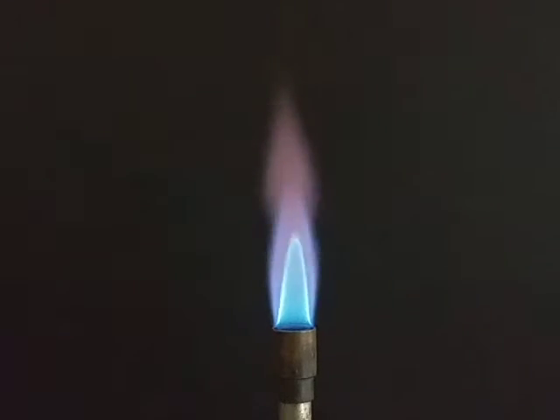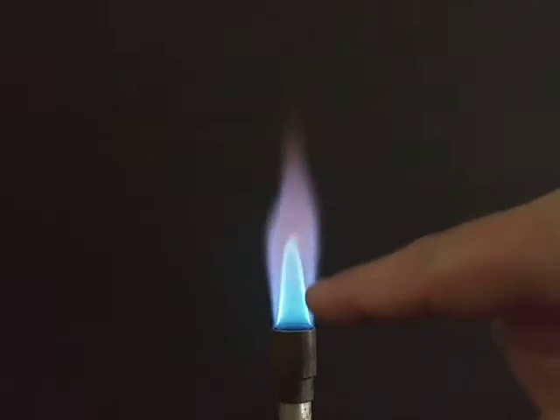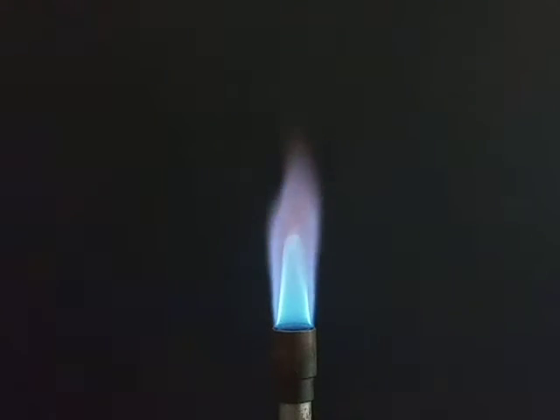Okay, here we go. I'm going to attempt to go through the flame test lab and show on camera the various flame colors for the chemicals we're using and then some unknowns. You'll notice right now I've got a burner flame adjusted for a hot flame. It has the center inner blue cone, which of course is unburned gases coming up. The hottest part of the flame is going to be just over the surface of that inner cone, and in particular right up at the tip.